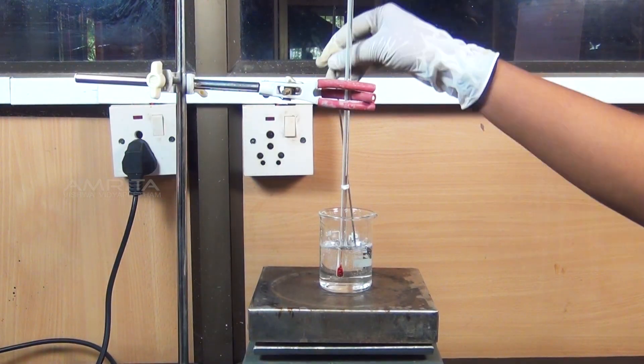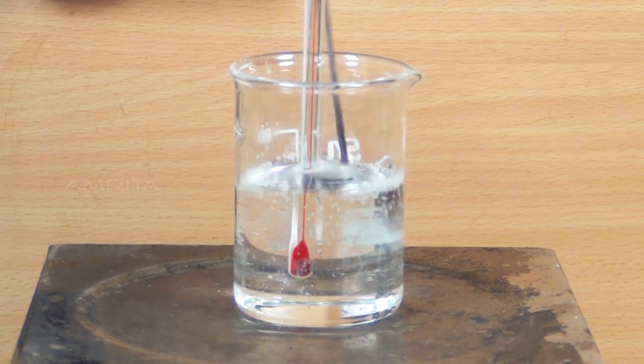Our aim here is to determine the melting point of the given compound, naphthalene.